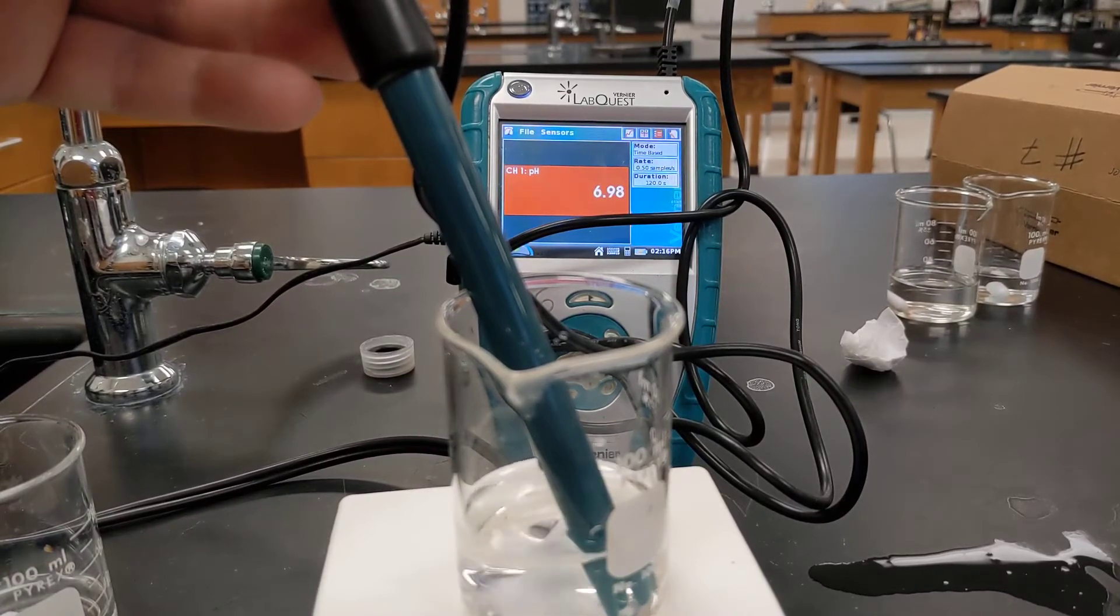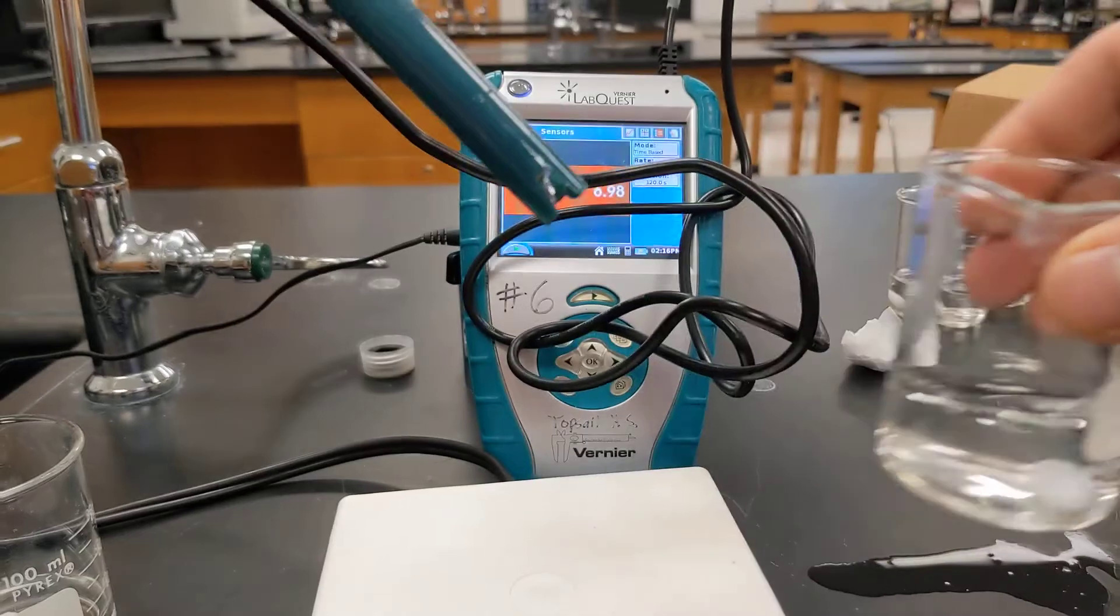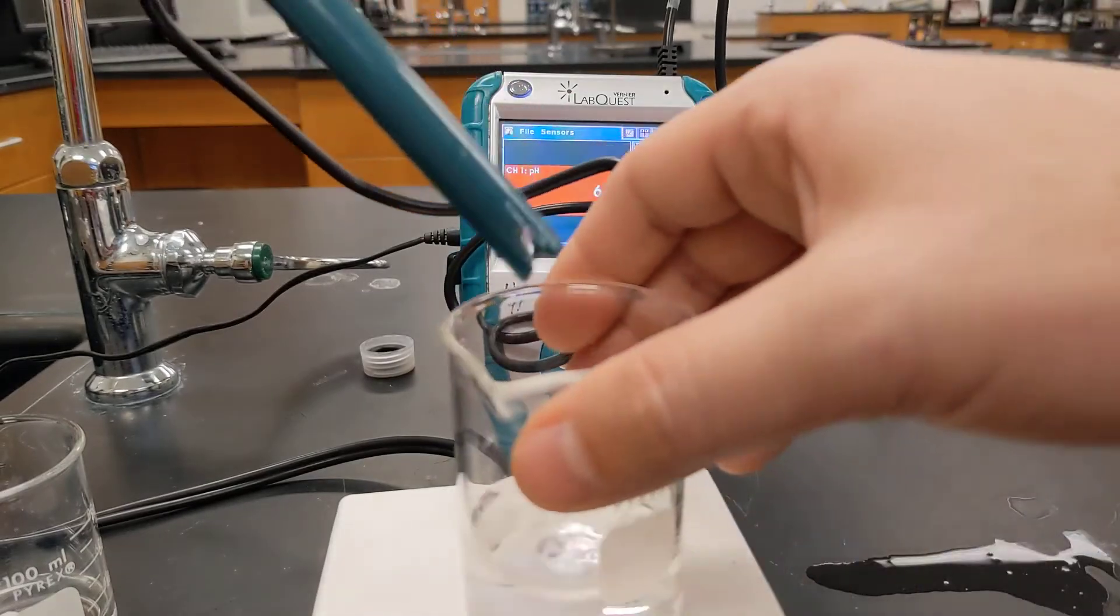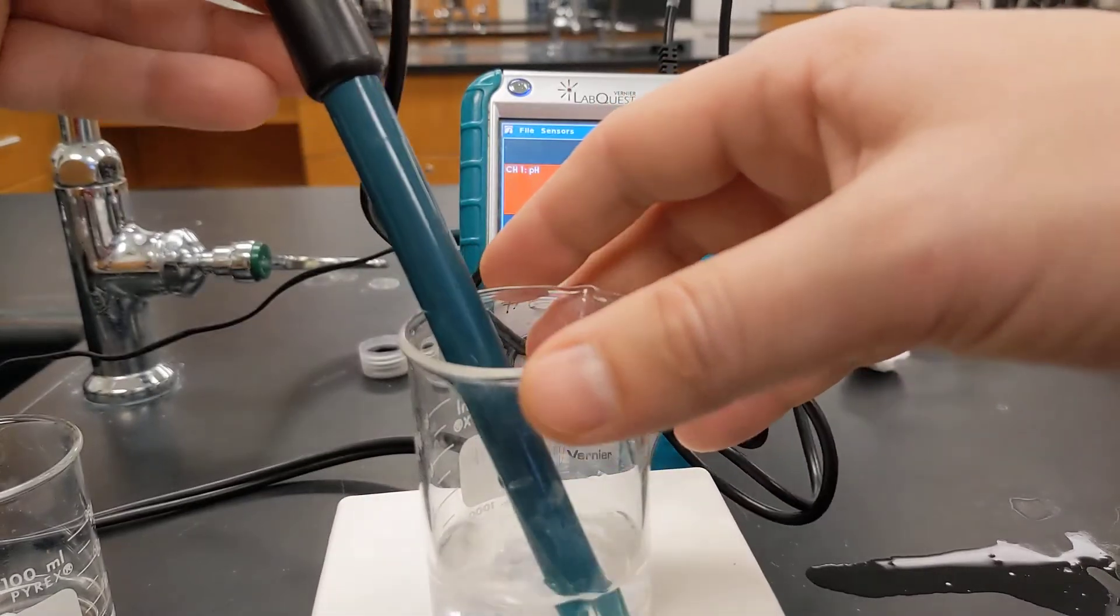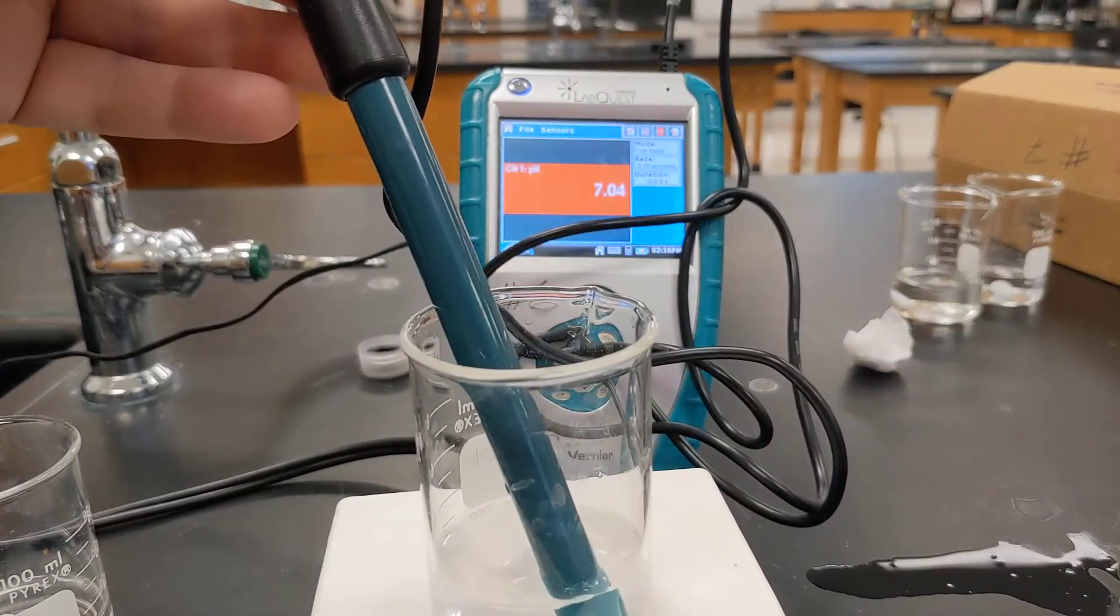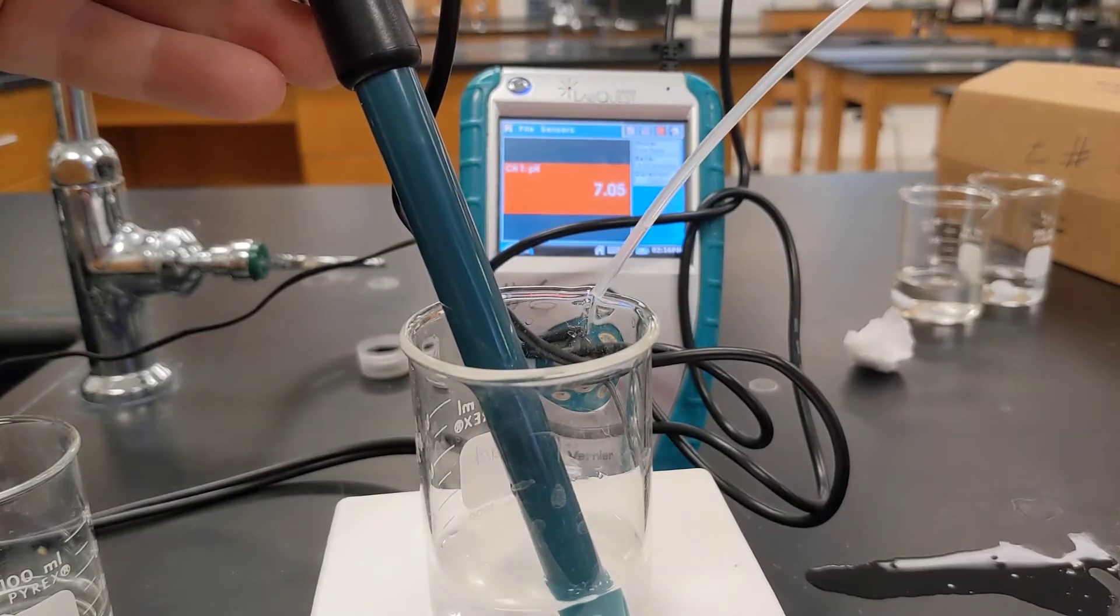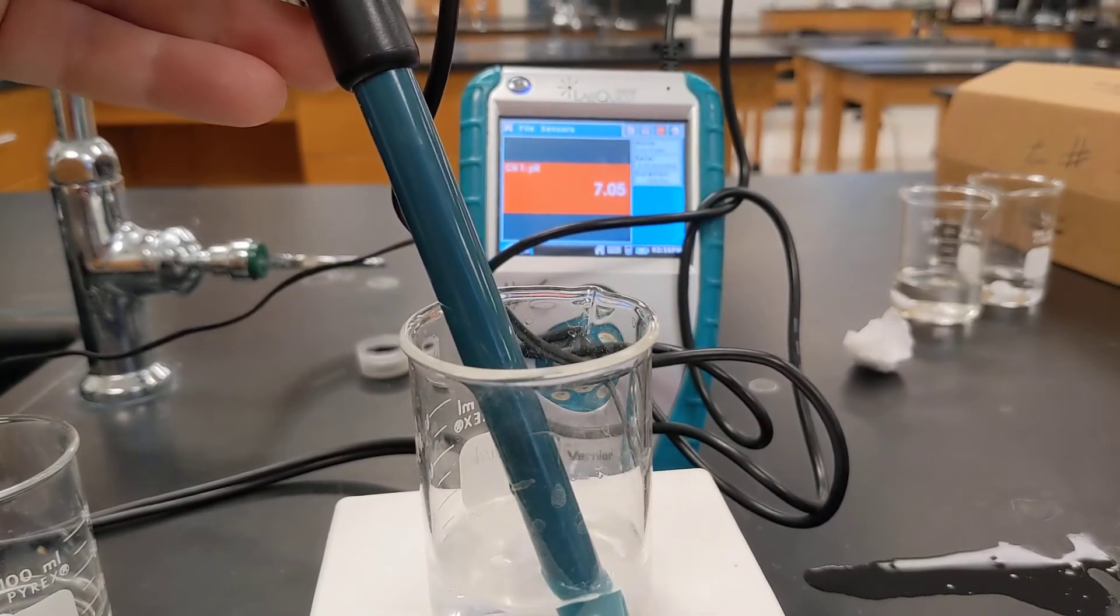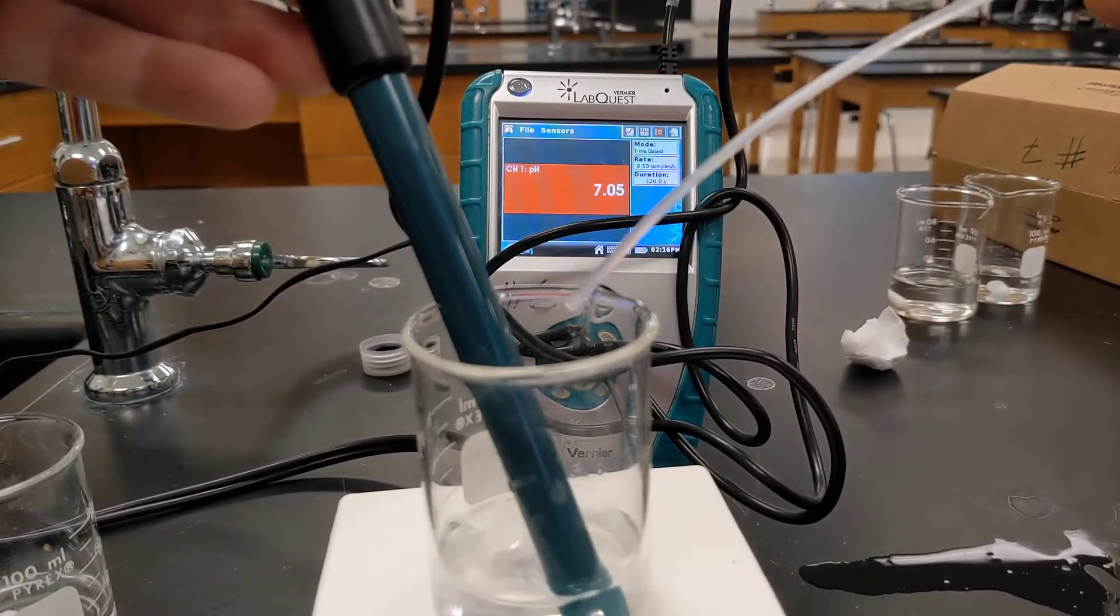Alright. So let's check out the buffer solution. Actually I can just keep, well let's try a different set of the buffer solution. We should be back to that pH. Let's try adding the base. Let's focus in on the pH there.